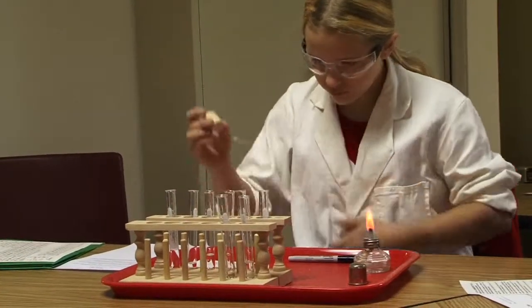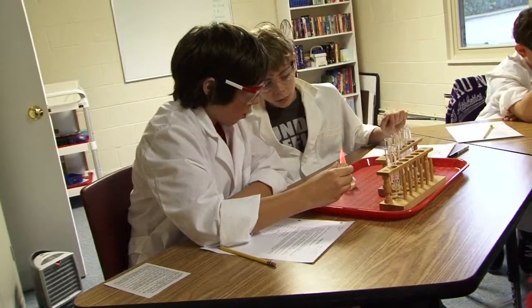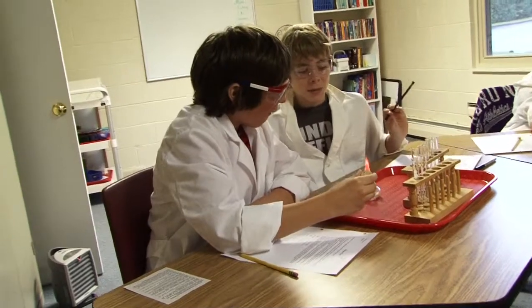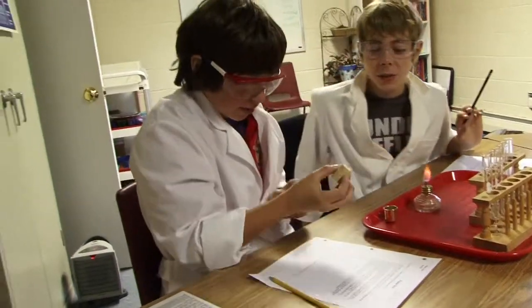Okay, I'm gonna dip it in the SR. Alright. Give it a little. Wow. That was pink. It looks red to me. That was pink too. It was pink-red.